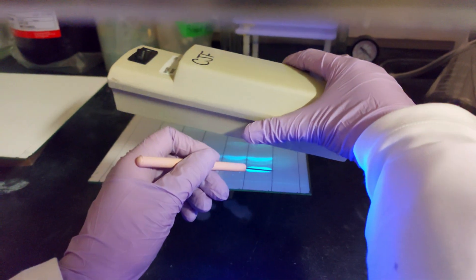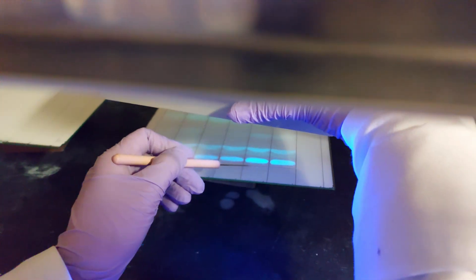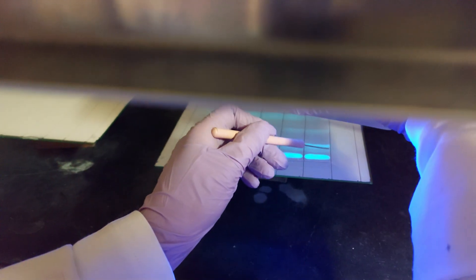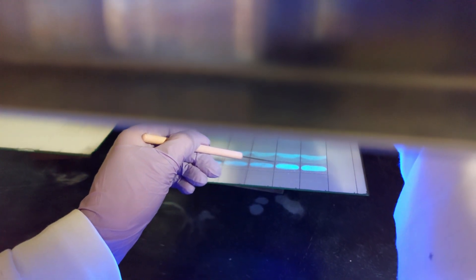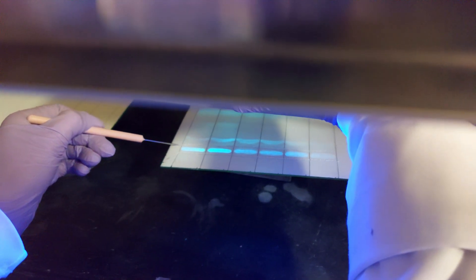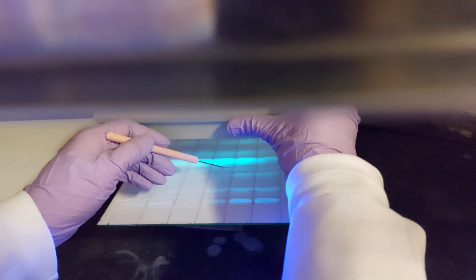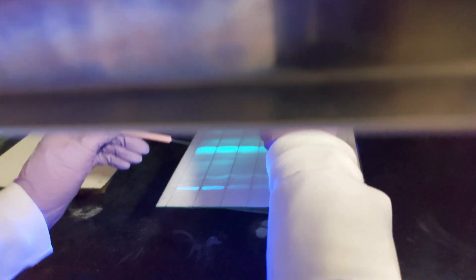She's just going to turn on the UV light and mark the bands so we know exactly where each sample is. We just need to mark the first one, which is our phospholipid — mark it very closely. Remember why I said not to make the spot too wide? We're really interested in the phospholipid and triglyceride bands, so just mark those.